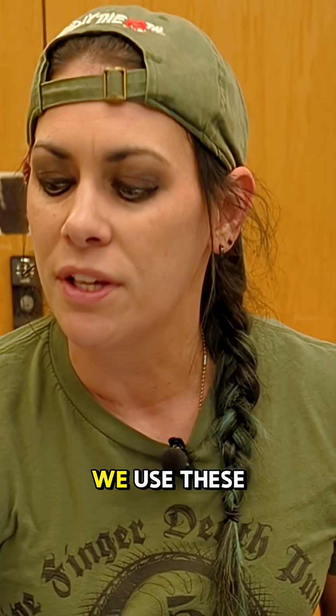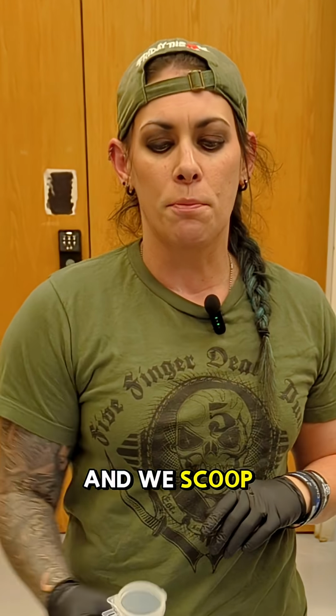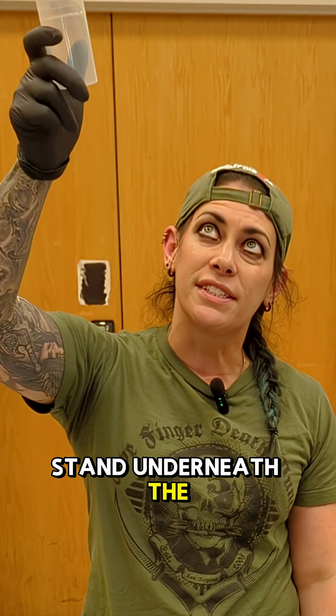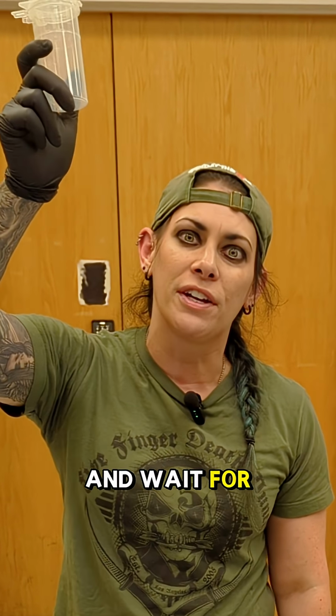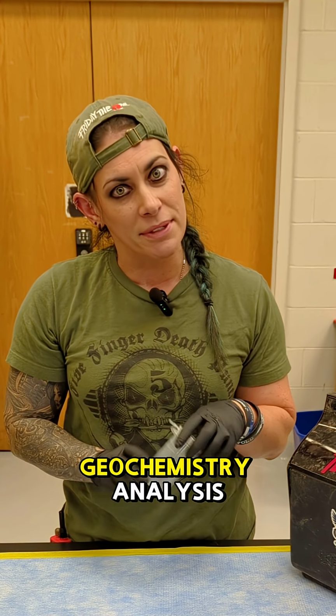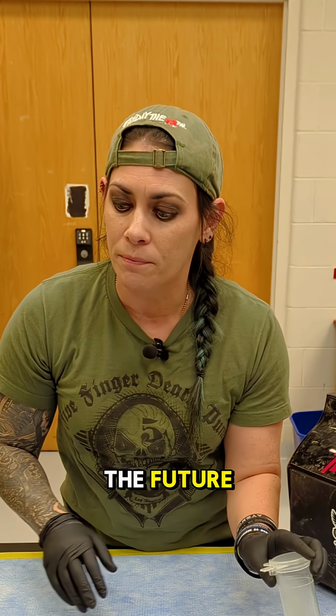So for water, we use these water collection tubes. They're 100 milliliters, and we scoop it in the water pools in the river and the spring, or we literally stand underneath the stalactite and hold it up and wait for it to drip forever into our sample collection tubes. This is for geochemistry analysis, ion analysis, and hopefully microbes in the future.